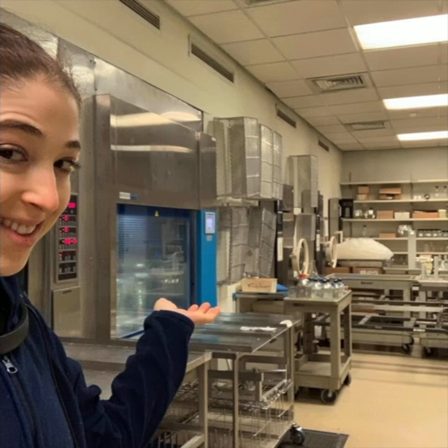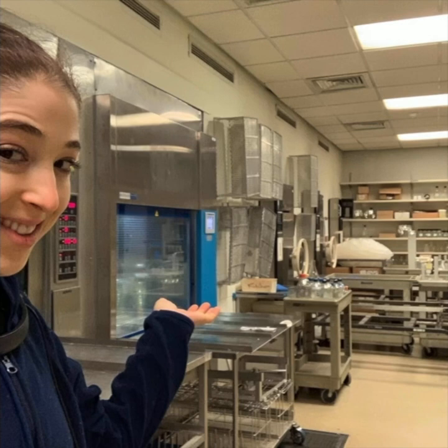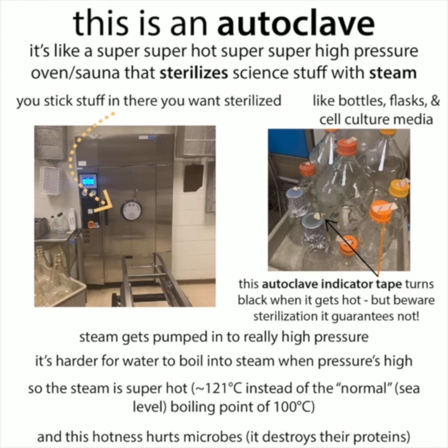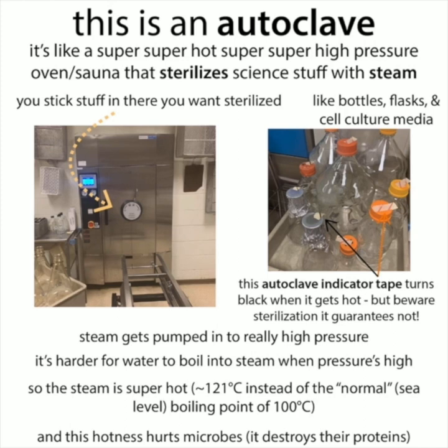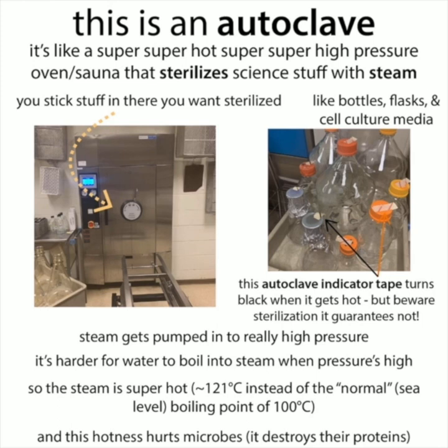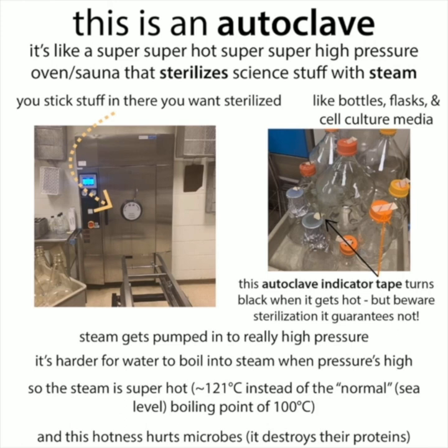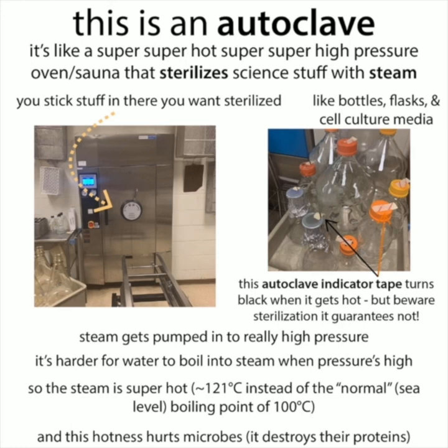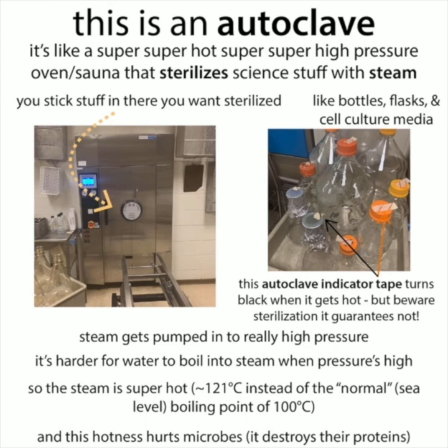All this food has to be sterilized before we give it to the bacteria, because we want to make sure only the bacteria we want to grow will actually grow. This is an autoclave — a high-pressure, high-heat sterilizing machine, kind of like a super high-pressure oven or sauna that sterilizes with steam. You'll see this indicator tape we put on top of bottles — it turns black when it gets hot, which tells you the autoclave at least got really hot so your media is probably sterile. I've always wanted to make joke things that come up on the tape, but usually it's just stripes or the brand name.